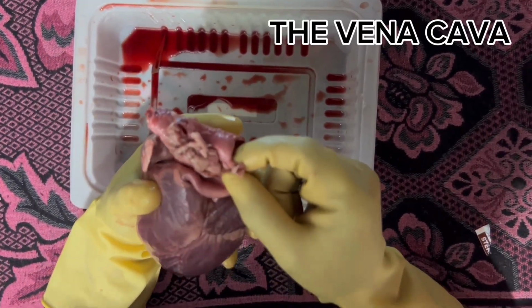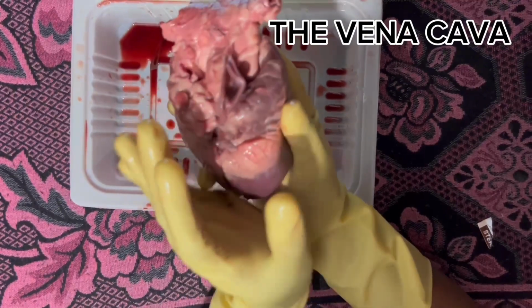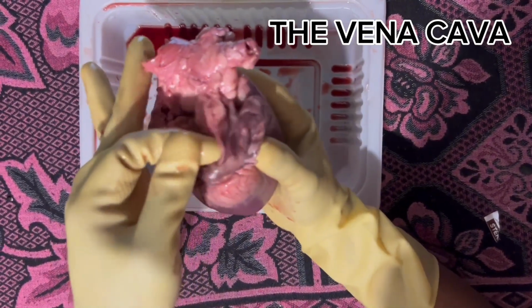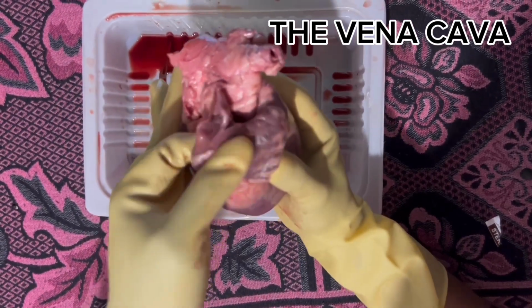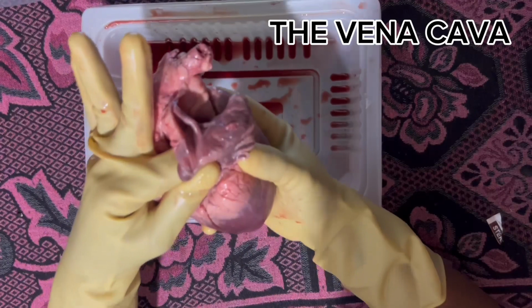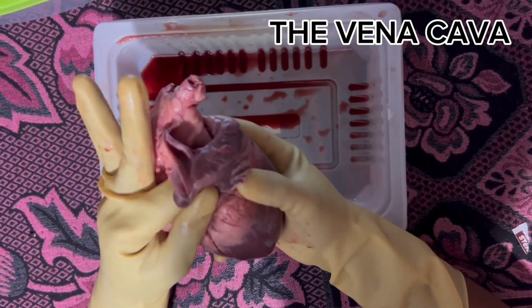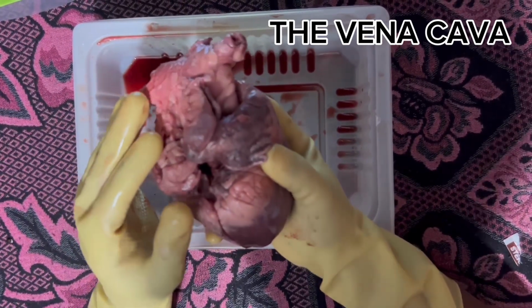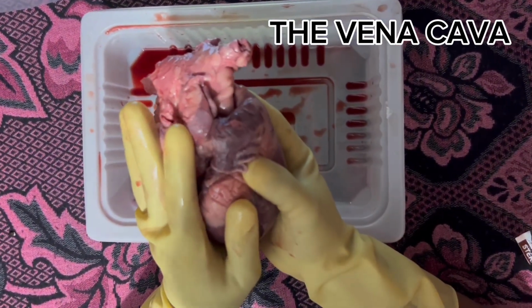Next is the vena cava. This is the vena cava, which is connected to the right atrium. It is connected to the right atrium. The vena cava brings deoxygenated blood to your heart to get oxygen.